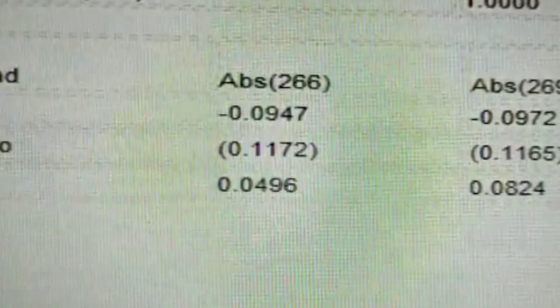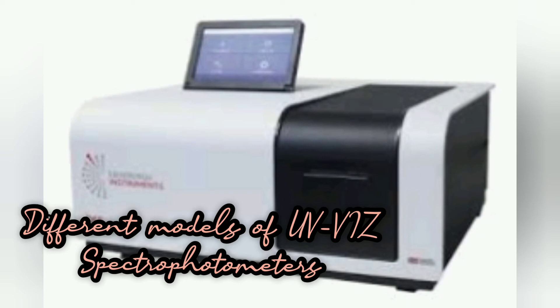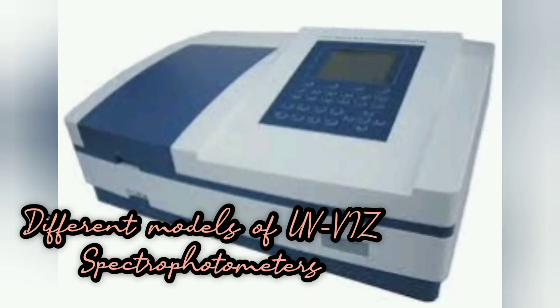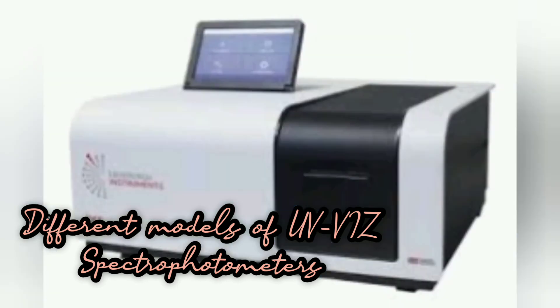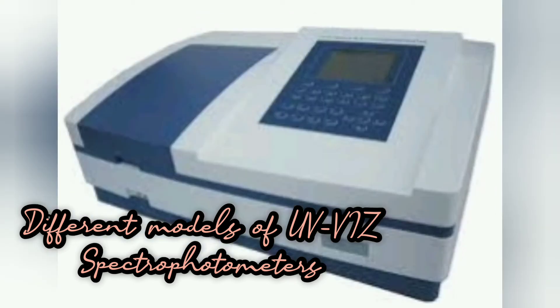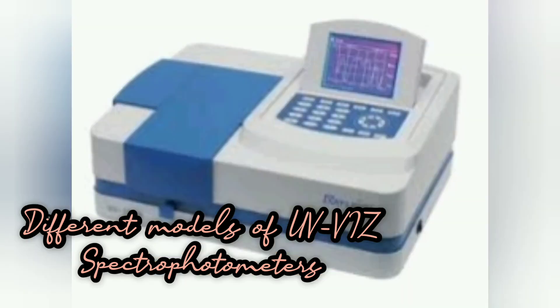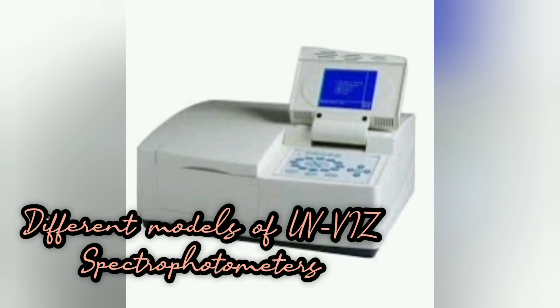This is how we calibrate the UV visible spectrophotometer for wavelength accuracy, control of absorbance, control of cuvettes, and resolution power. Regarding maintenance and repairs: when the instrument does not comply with the specified tolerance ranges, it must be labeled as out of calibration and repaired or serviced. After repair or maintenance, the instrument must be calibrated again.